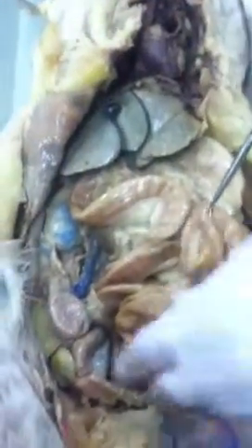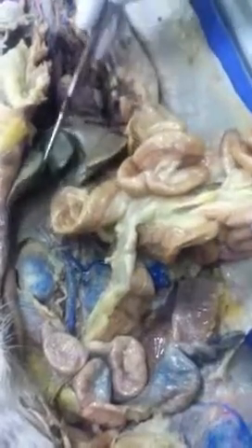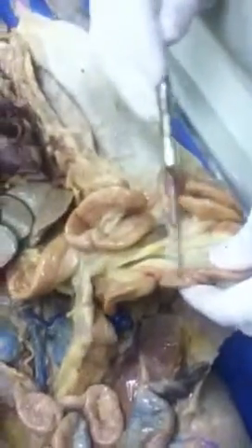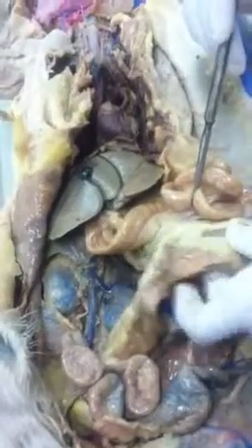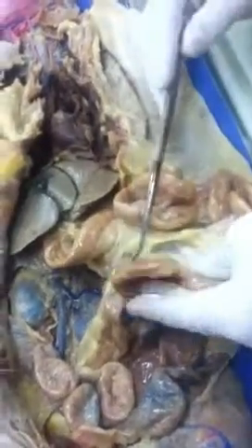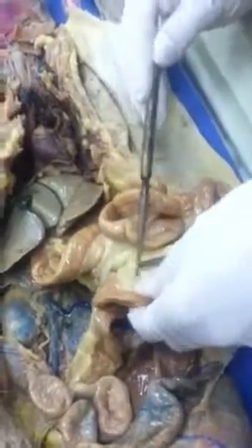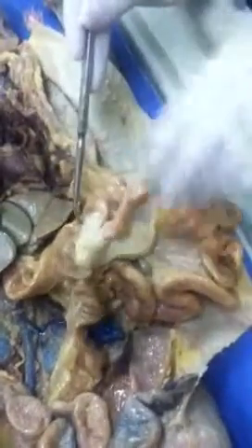And then the final section that attaches to the cecum, or the first part of the large intestines, what's that? The ileum, right. So if I do duodenum, I'm going to have it right at the start. If I do ileum, I'm going to have it right at the end. If I do jejunum, it'll be right in the middle, okay? So, what's the name of the junction between the ileum and the cecum called? Ileocecal valve, and this is where the appendix is.